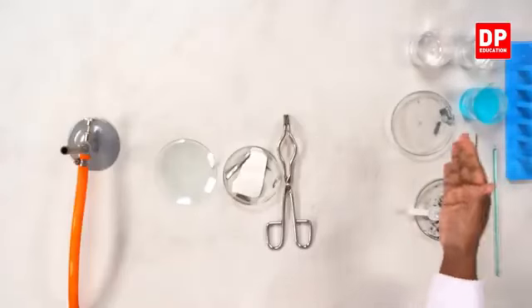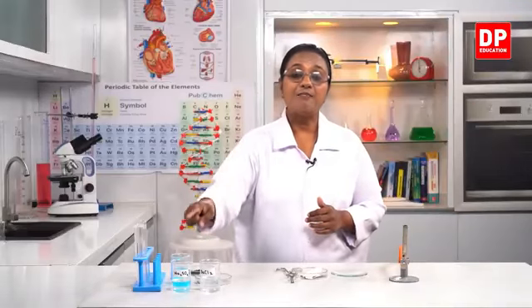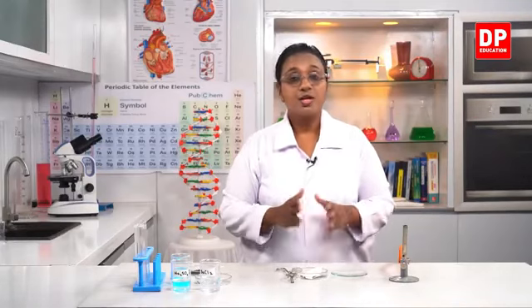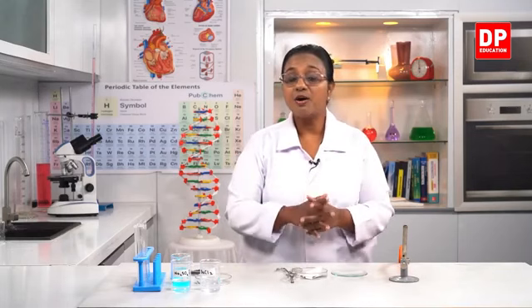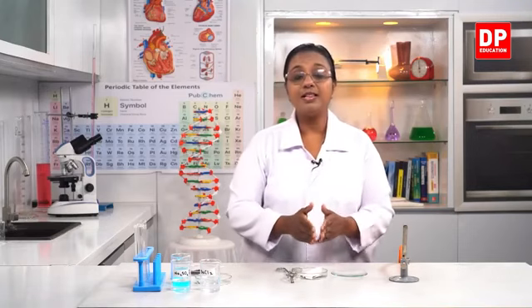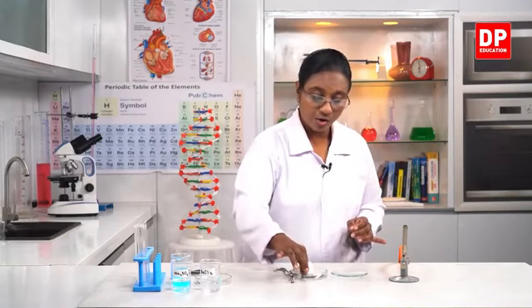Thereafter, I have two substances, copper sulfate and zinc. So again, two reactants. When they react, what will they produce? And finally, we have barium chloride and sodium sulfate. Again, two substances, two reactants, how will they react? So based on all of these observations, we will be able to classify the different types of chemical changes taking place. I'll start the reaction with the magnesium strip. So already you all know students, we have done this activity before also.